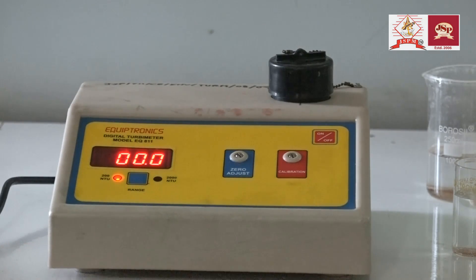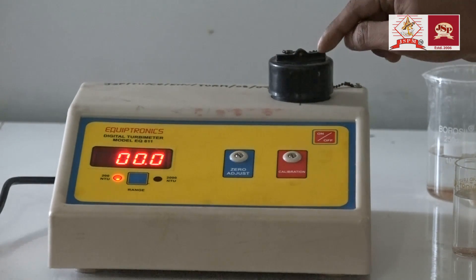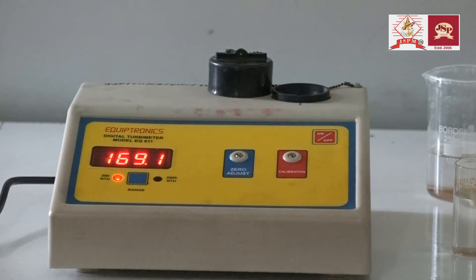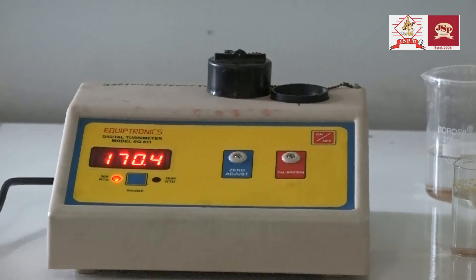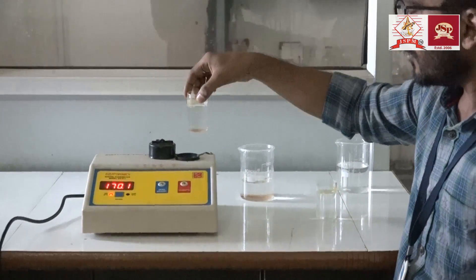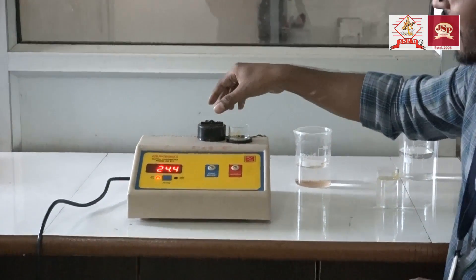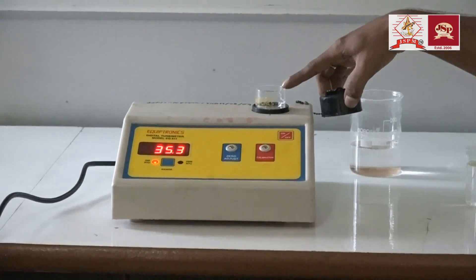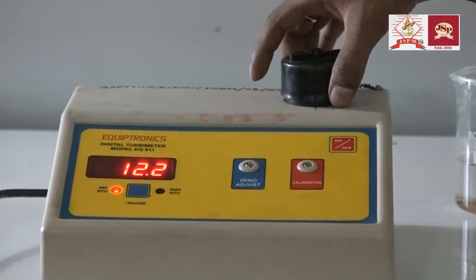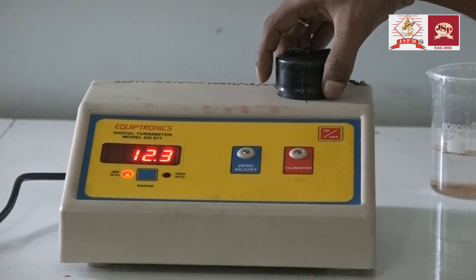Okay, it is zero. Now we have to put the given water sample in this tube. I will take out the first glass of distilled water and put the water sample for which I have to determine the turbidity. I have put this glass tube into the space. Now close this lid perfectly because it is working on the principle of light scattering.